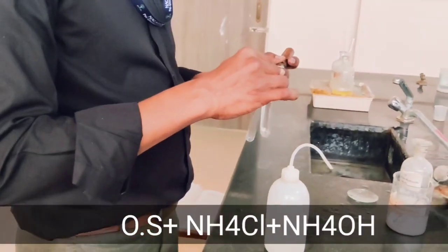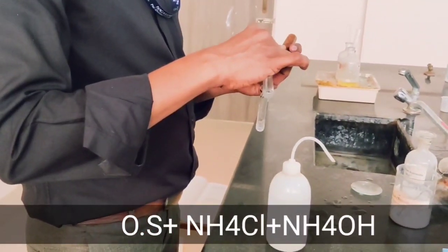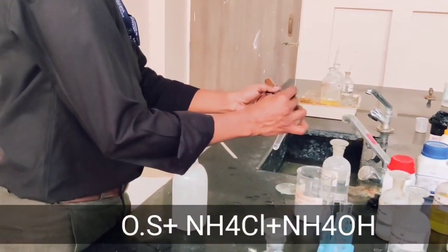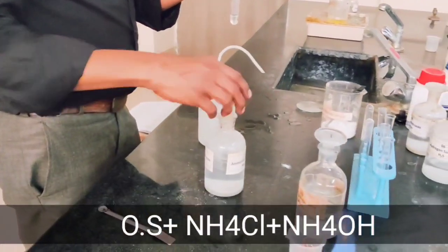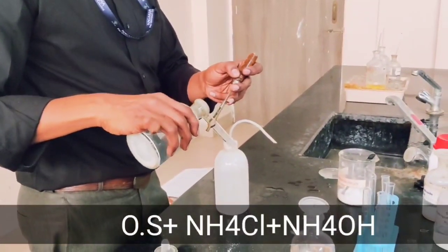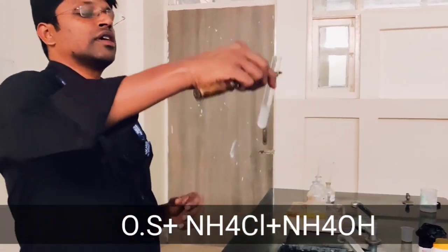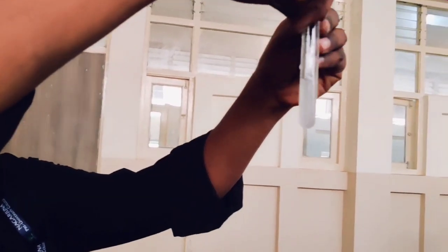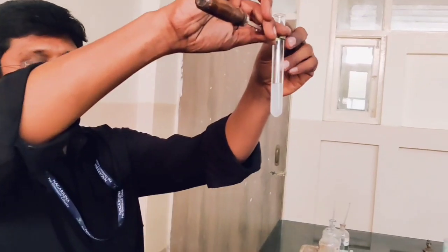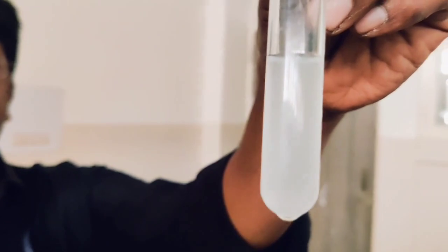Group 3 contains aluminium. For aluminium, we have to take the original solution and add ammonium chloride and ammonium hydroxide. If a gelatinous white precipitate appears, aluminium is present. We cannot see any glue-like substance floating, so aluminium is absent. The third group solution, which doesn't have the gelatinous white precipitate, should not be discarded.